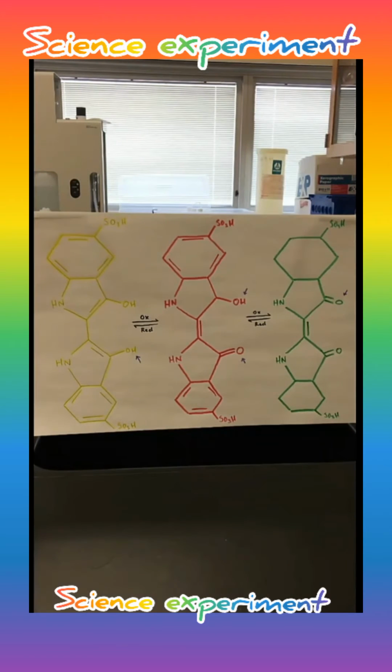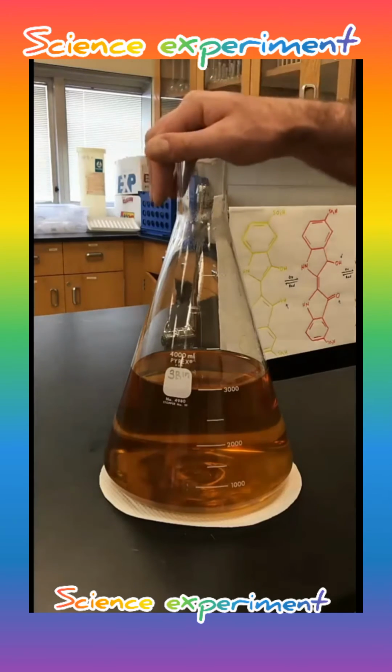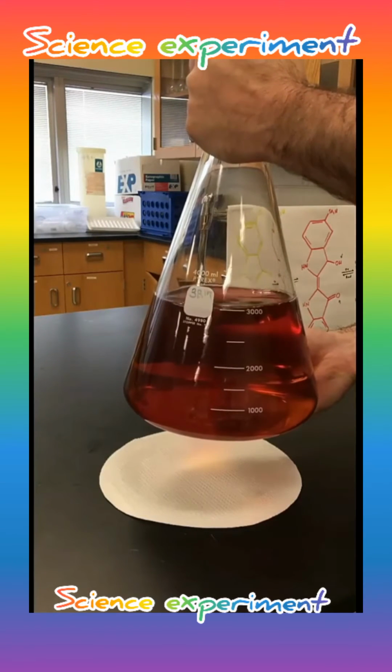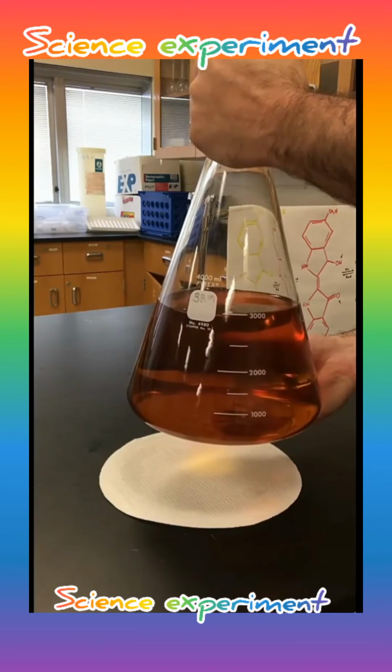So there we've drawn out the different stages of the molecule for you. And there we have our final solution. Starts out yellow, give it a little shake, incorporates some oxygen, oxidizes that indigo carmine up to red. The sugar reduces it back to yellow.